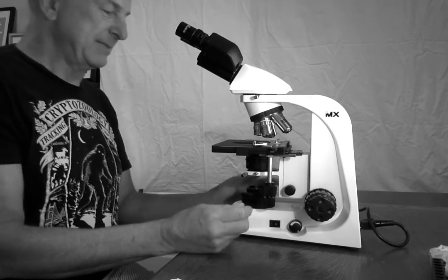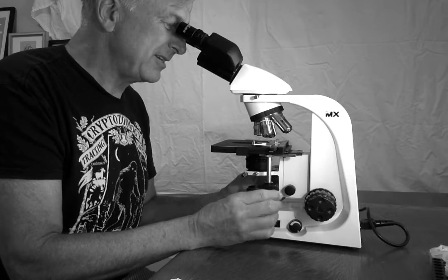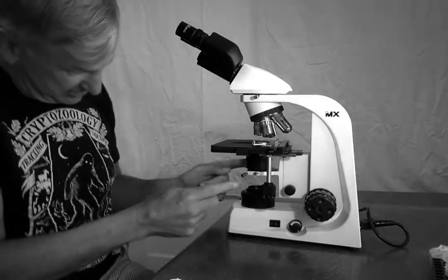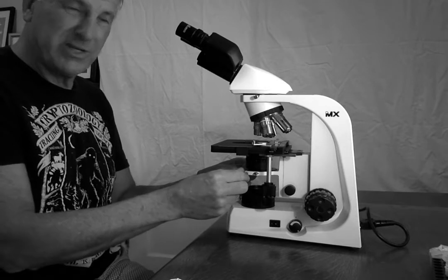Now I'm going to see if it's centered. Is that little dot in the center? It kind of looks like it's in the center, but it's hard to tell. So I'm going to play with these adjustment screws. They're silver. There's one on each side. They come out at a 45-degree angle.